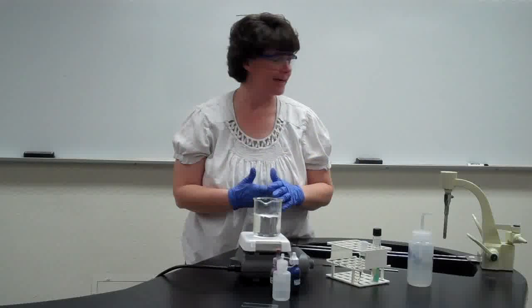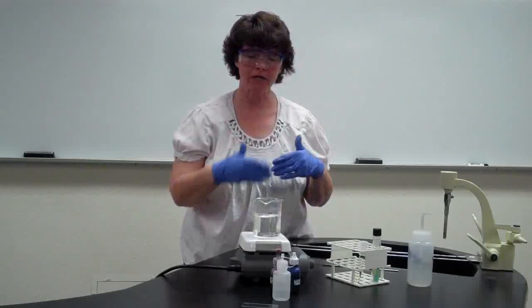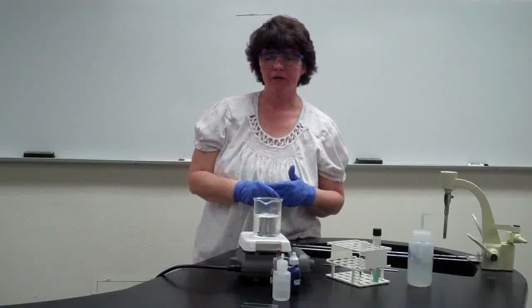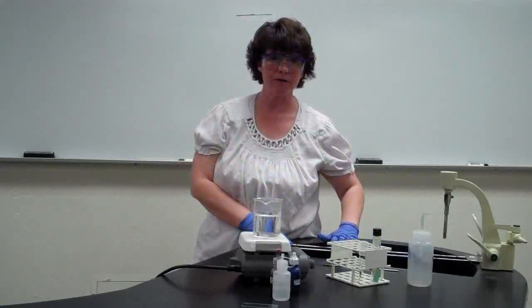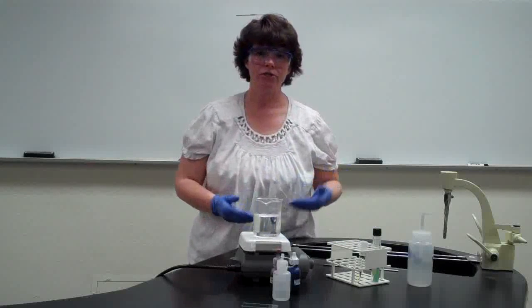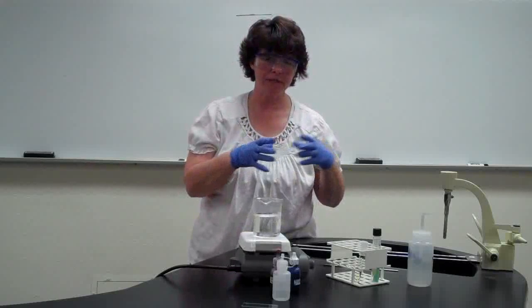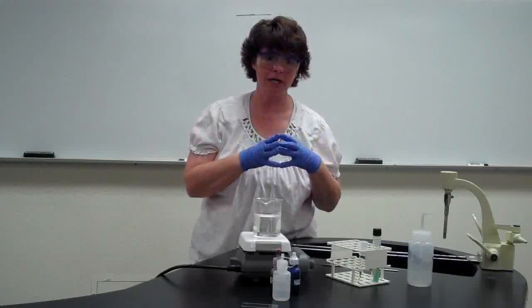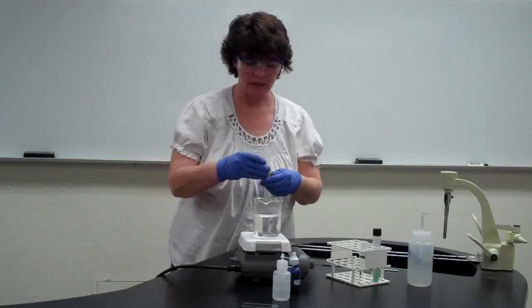The changes that I'm making are going to be in the actual procedure of the staining. So in the staining, in our lab manual, it just says to flood the smear with the carbol fuchsin and allow it to sit for 5 minutes. I'm going to use a different procedure, and we're going to use heat to try to get the stain to actually penetrate the slide, to penetrate the bacteria. Because of that waxy coat, it's really hard for the stain to actually penetrate the wall of it. So that's going to be the first change that you're going to see.